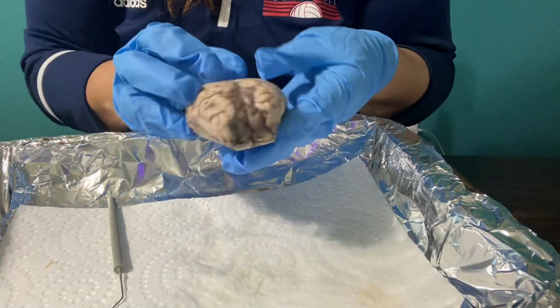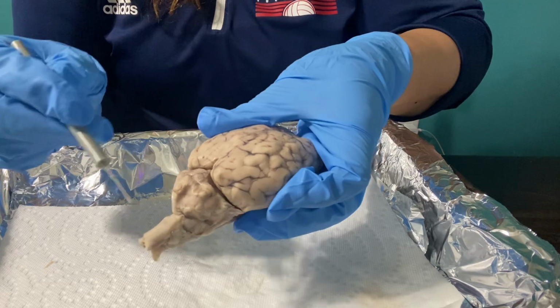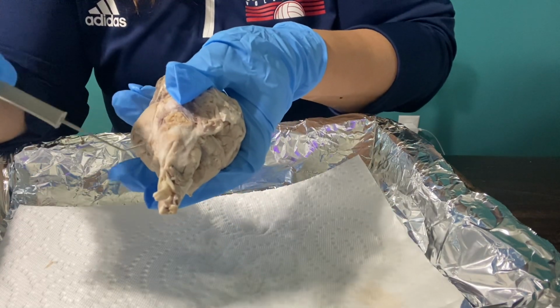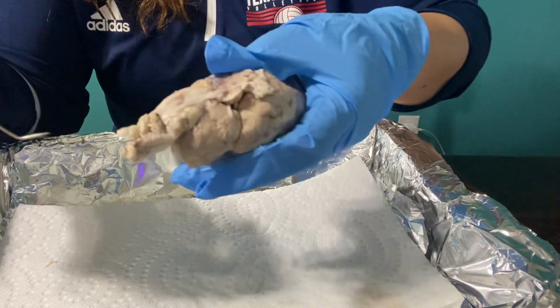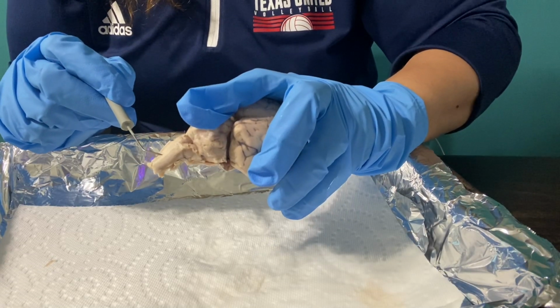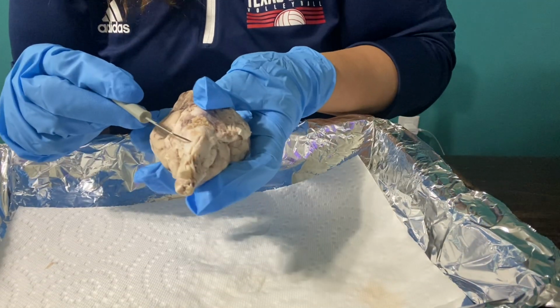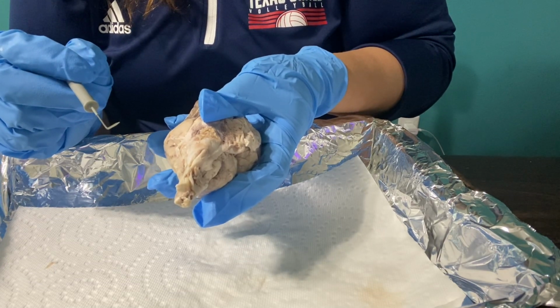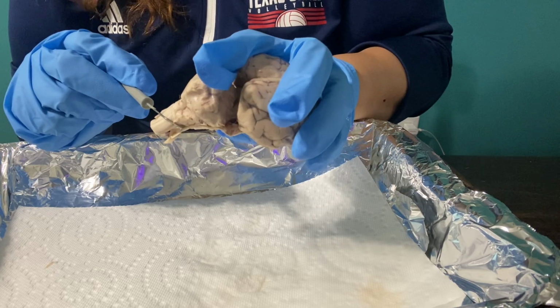Okay, now that I have showed you the cerebellum, I want to talk about this section right here, which is the brainstem. Let me flip it over so you can see it as well. Here is my brainstem section. The brainstem here is composed of the midbrain, which handles visual reflexes. Okay, it's right here. The brainstem is vital for sustaining functions like breathing, the heart rate, as well as the blood pressure and the sleep-wake cycle, okay?